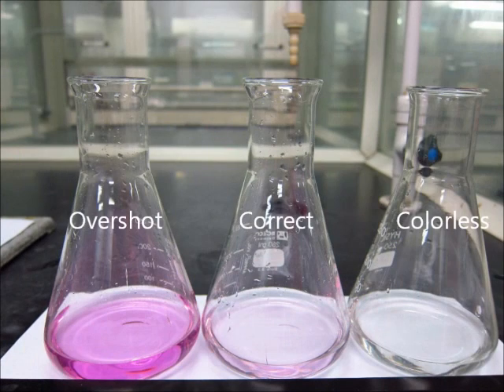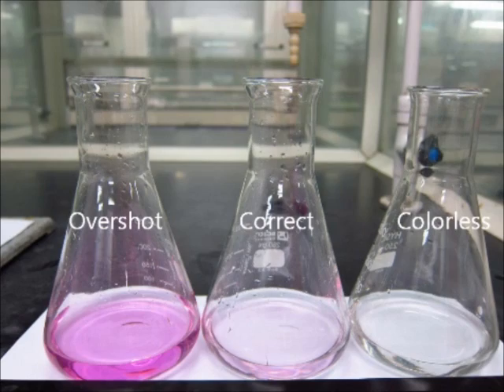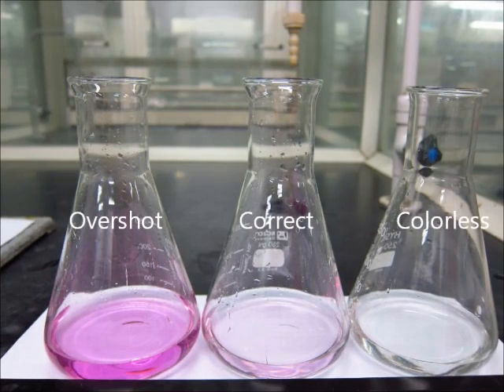And finally, you see a comparison of the colour intensity. You need to achieve the middle one. Just a tinge of pink.